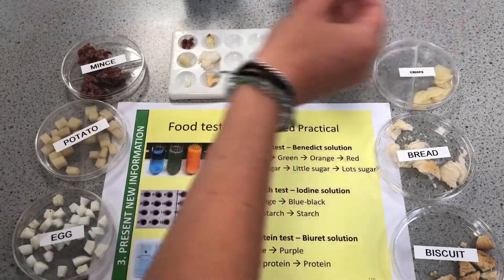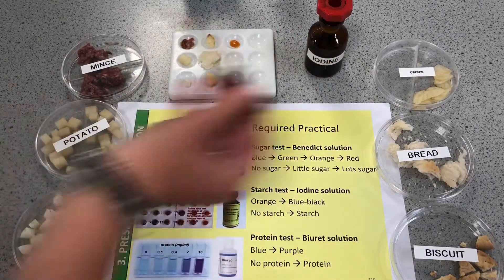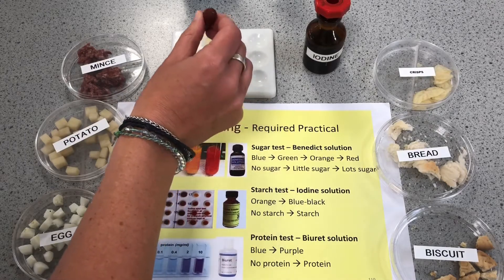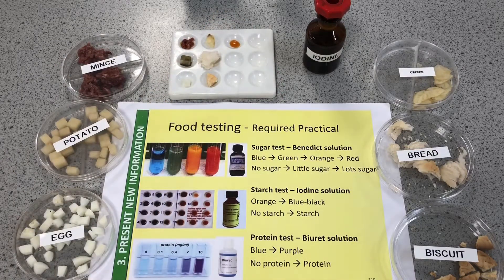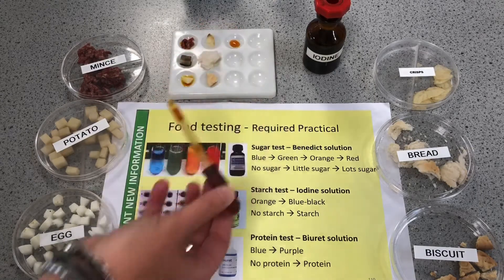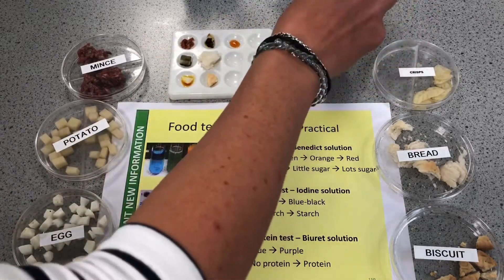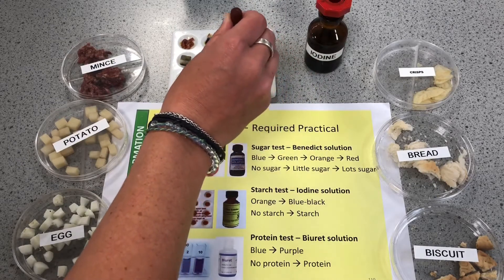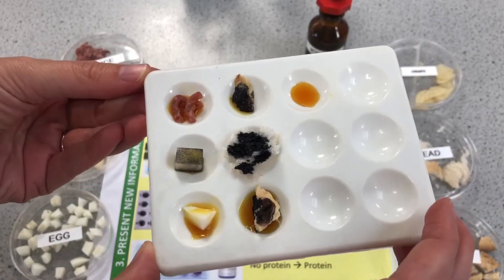Adding iodine solution to the meat — not much of a change. Here's what the iodine looks like on its own: that orangey-brown color. Onto the potato — we know that potato has starch in it, and you can see there we've got that black color. Onto the egg — it's not very absorbent so no color change. Onto the crisps — yes, we can see there is starch. Lots of starch in the bread, and onto the biscuit — again a positive result for starch.